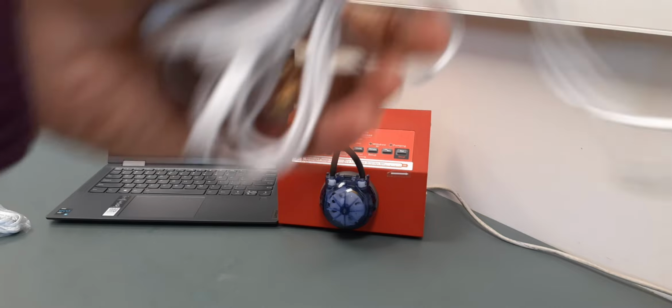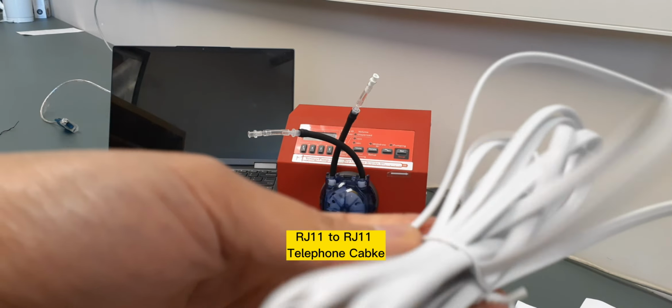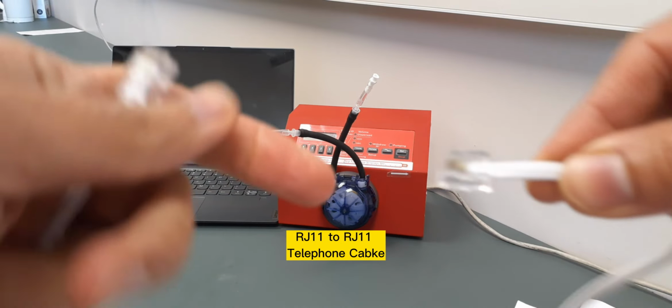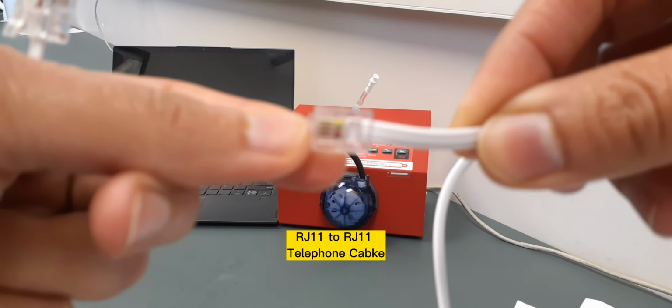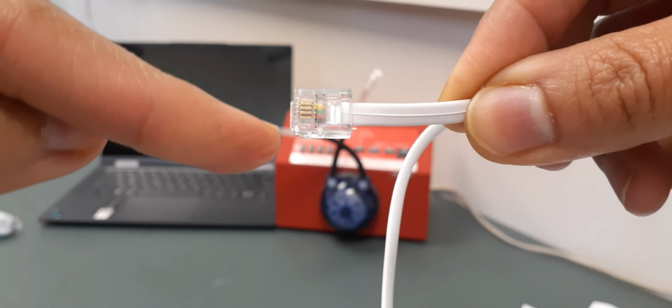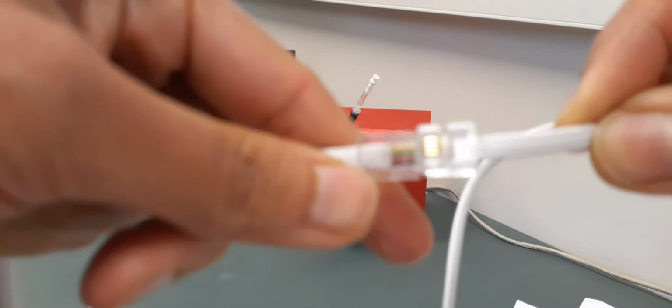And also you will need another cable, which is a telephone cable. This telephone cable should be RJ11 to RJ11, which is the pins here. As you can see, it's black, red, green, and yellow, and the same thing is here. So it should be the same: black, red, green, and yellow. So we have these pieces.